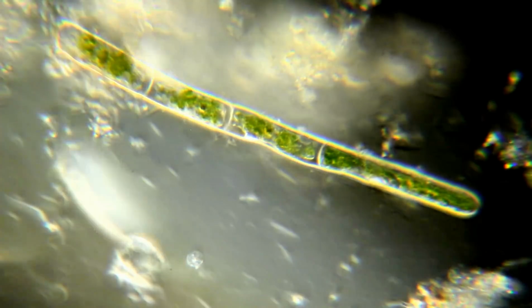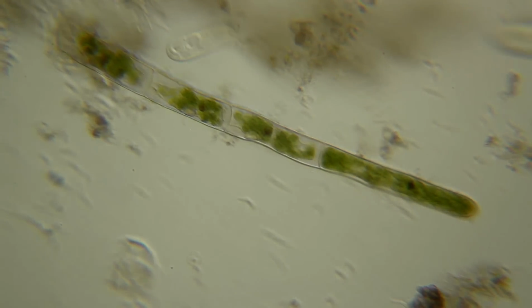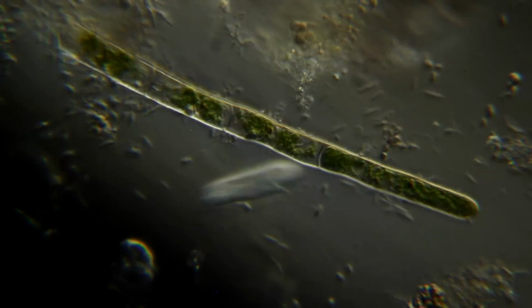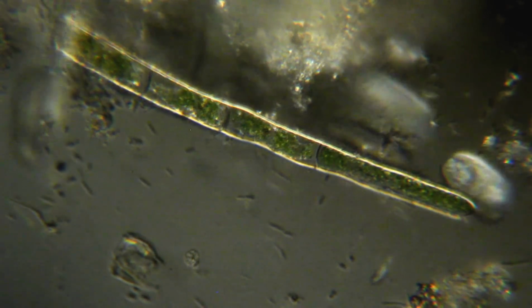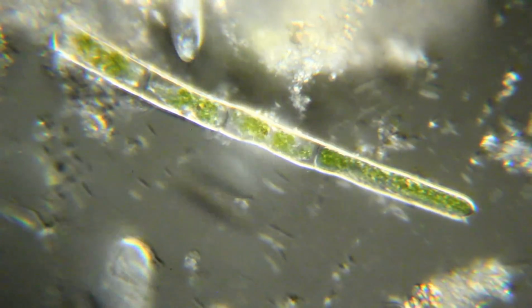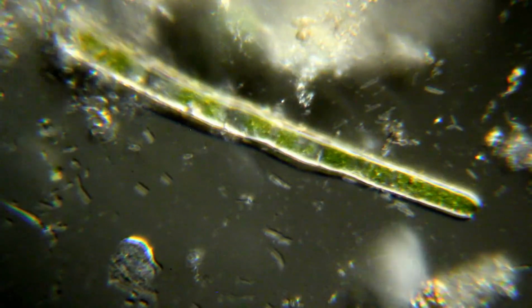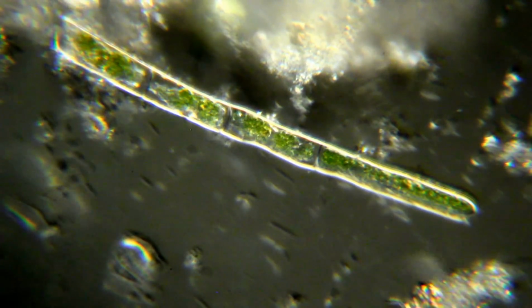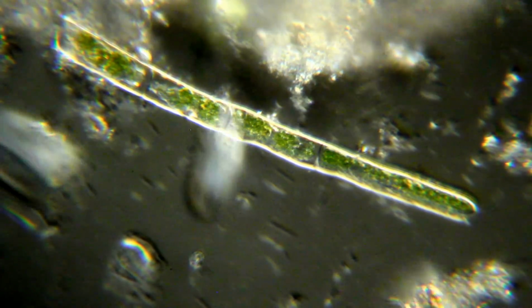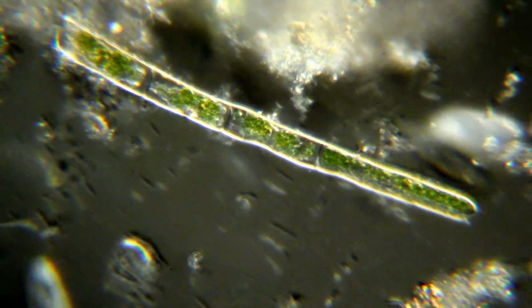And I can rotate to another position here, and get fairly good dark field, but not the way it should be. And I think there's some aberrations going on because of the lens not being in the right position on the condenser.